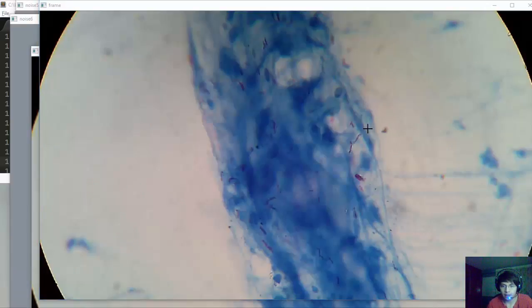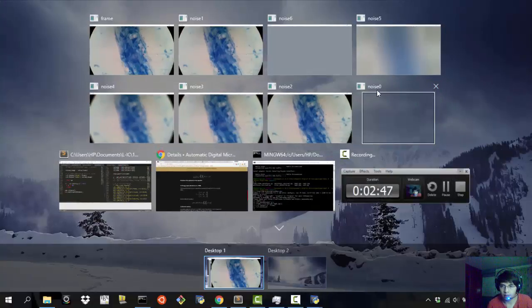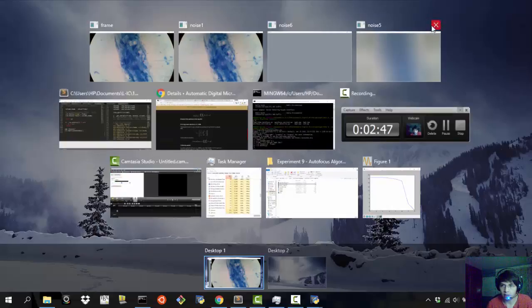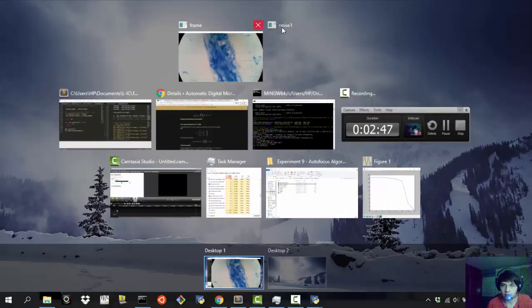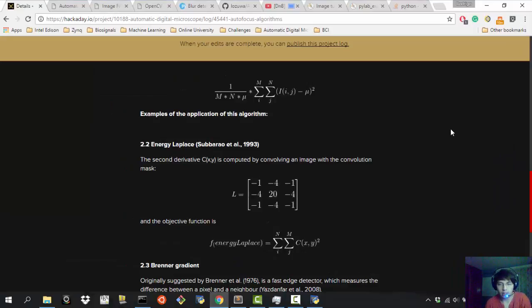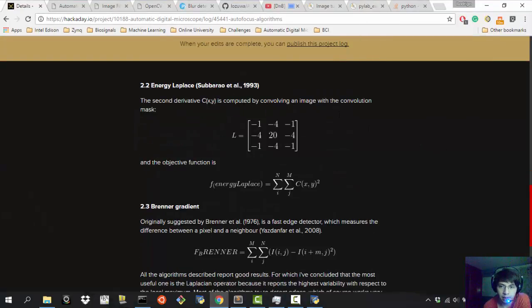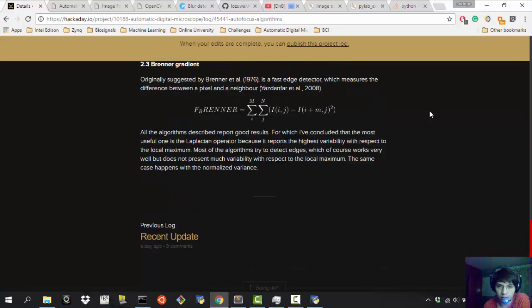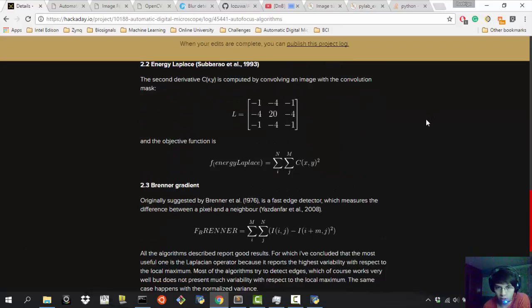image. Okay, and we'll have to close this all manually, so I'm just going to make this as quick as I can. And then we're going to pass to the energy of the Laplace algorithm that is going to measure what happened, that's going to measure the focus of the image.